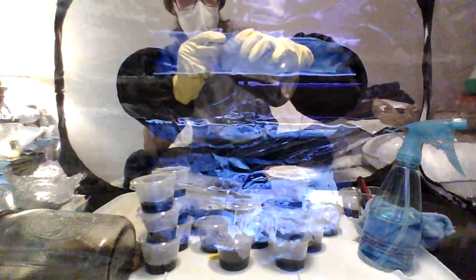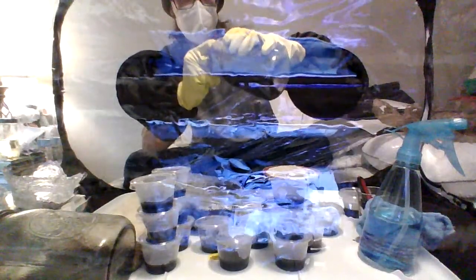So I have my trenchers here. We're going to try to make a trench in this agar at some point without dislodging it if I can. Sometimes gloves are not easy to work with. Not going to lie. You know, I can't do it like that. I'm used to using Petri dishes.